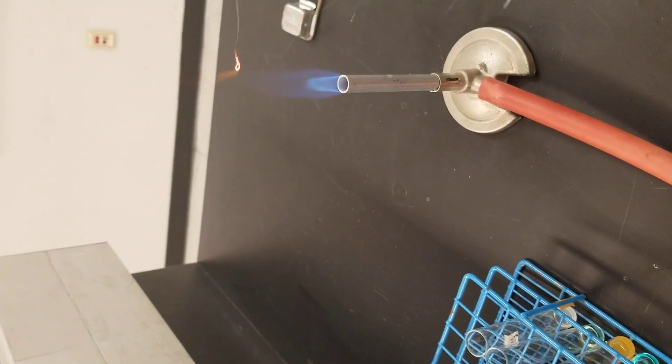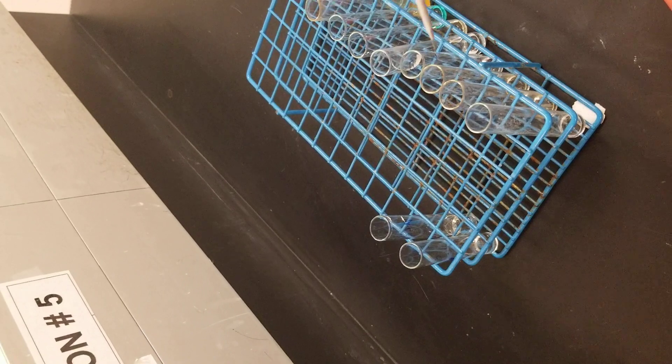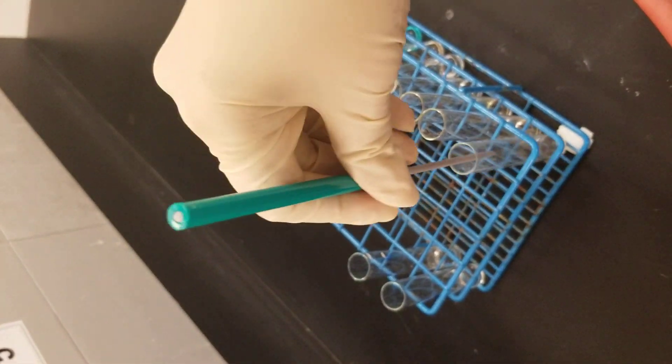Then I'm going to dip this into the first metal halide solution. The first solution is lithium chloride, which is a known metal halide solution.